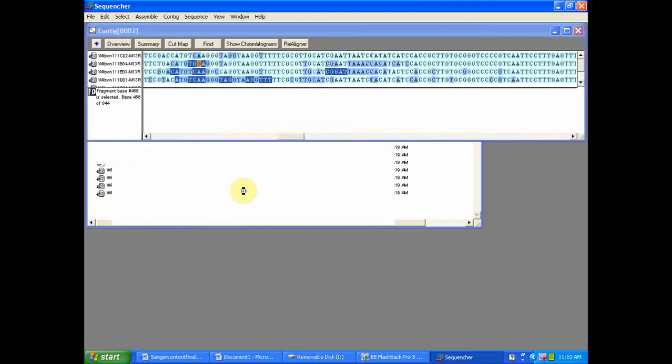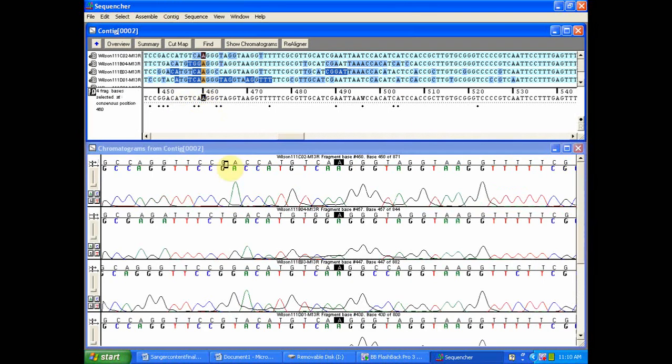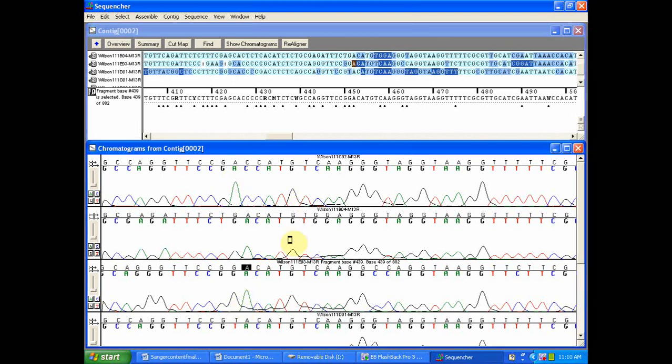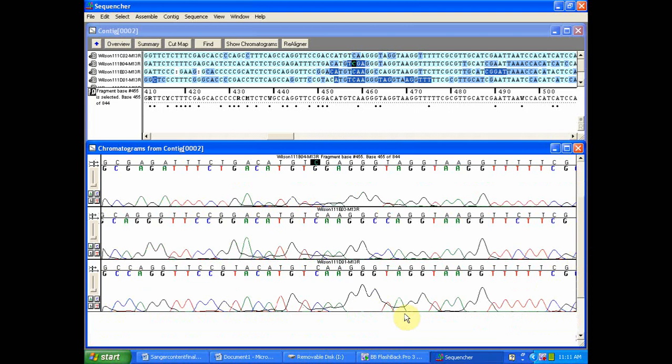We've designed Sequencher to be a highly customizable and powerful program, meaning it's robust enough to import thousands of sequences and align them in a short amount of time, and it's also refined enough that you can customize the program to your own user preferences and specifications. It's also important as I move through this to point out that the order by which I chose to illustrate the important features of data quality is in no way a set protocol.